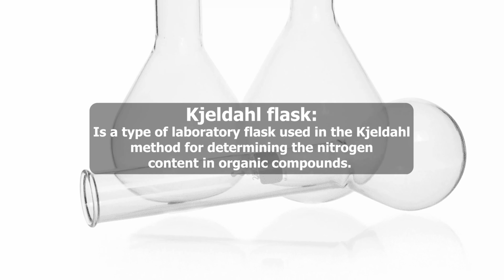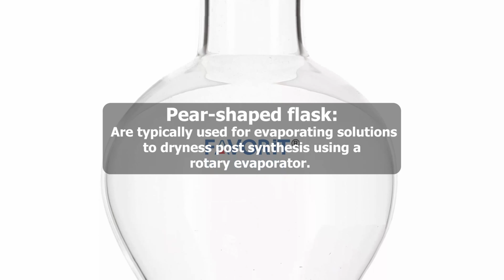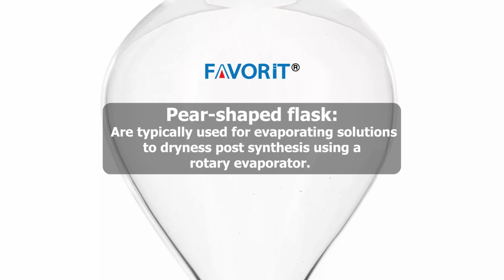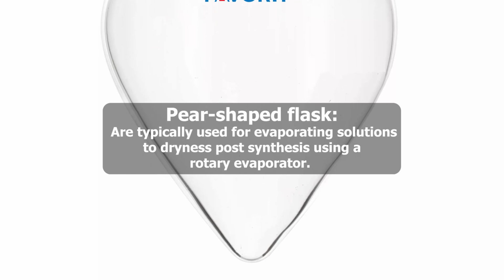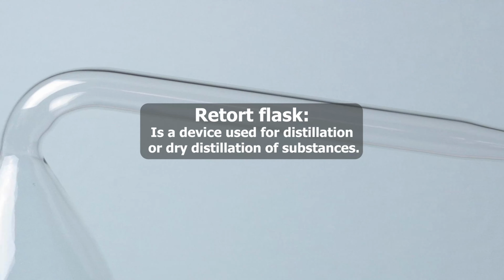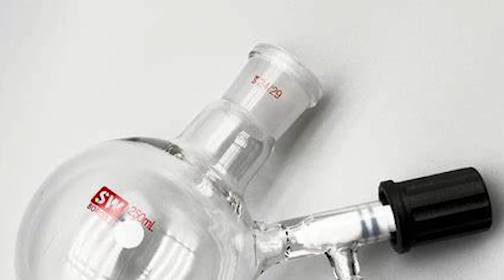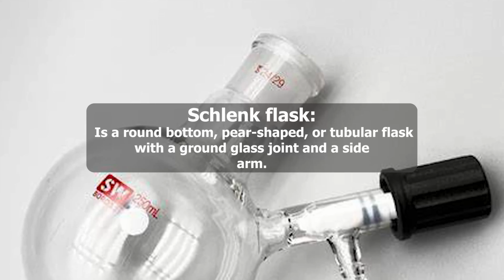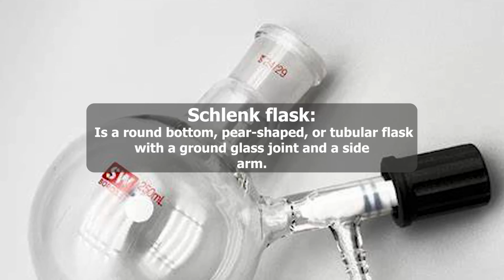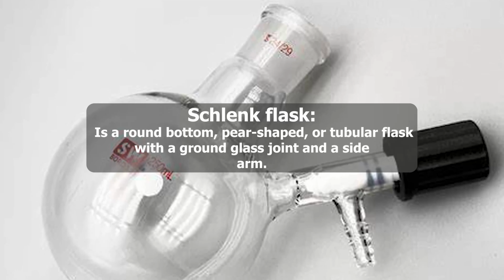organic compounds. Pear-shaped flasks are typically used for evaporating solutions to dryness post-synthesis using a rotary evaporator. Retort flask is a device used for distillation or dry distillation of substances. Schlenk flask is a round-bottom, pear-shaped or tubular flask with a ground glass joint and a side arm.